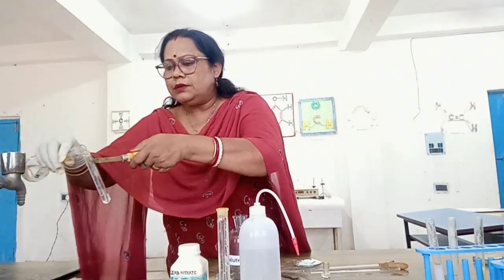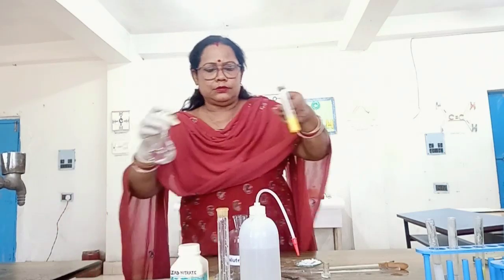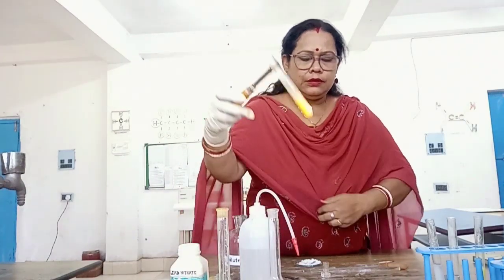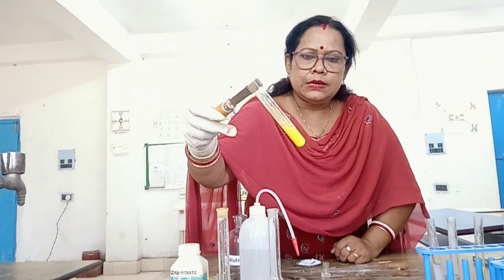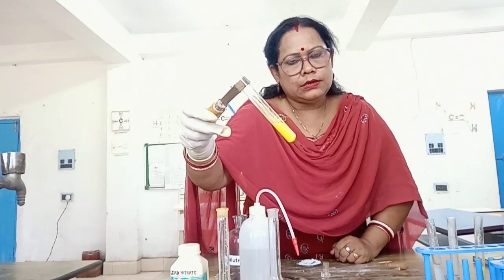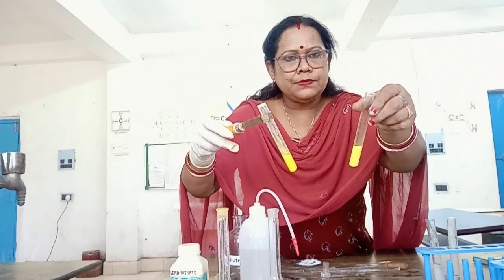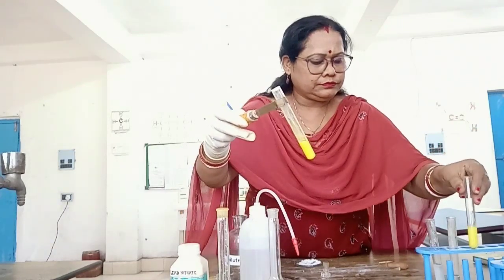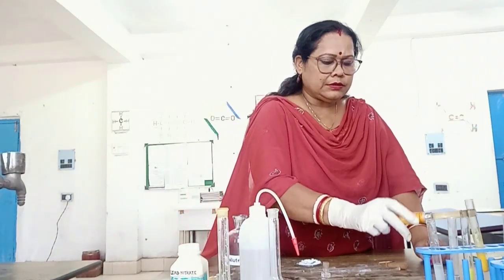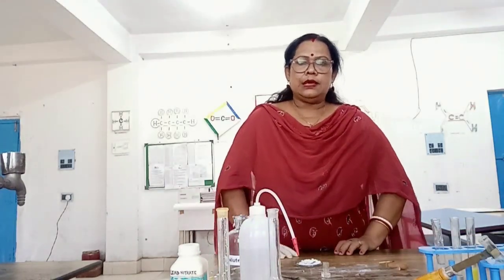Lastly, a few drops of potassium iodide are added to the third test tube. The formation of a yellow precipitate confirms the presence of lead. Hence, the lead cation is present and confirmed.